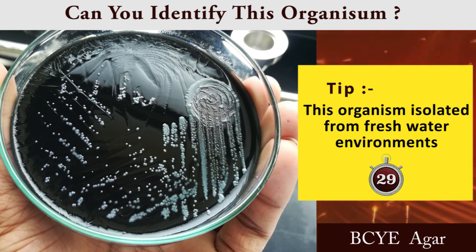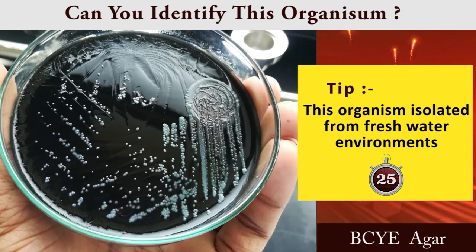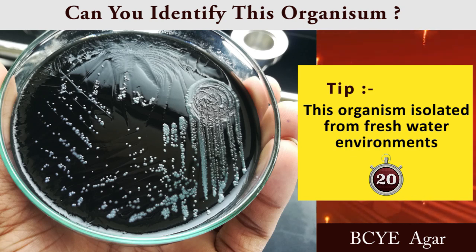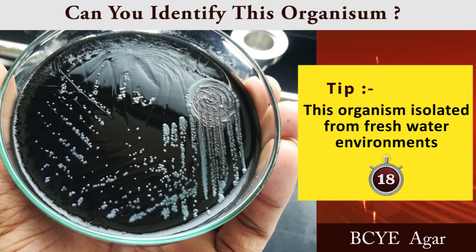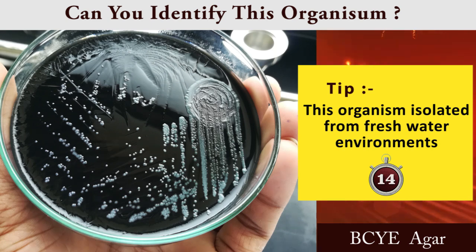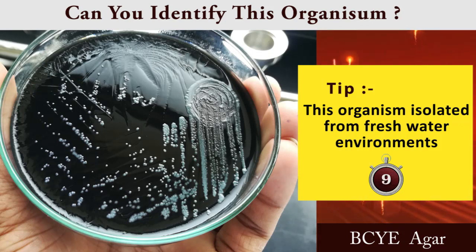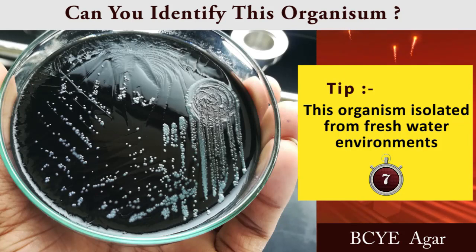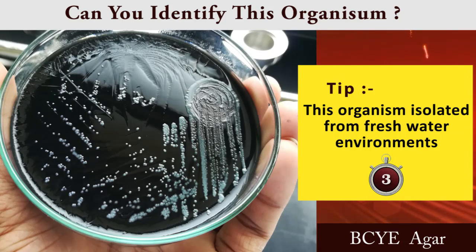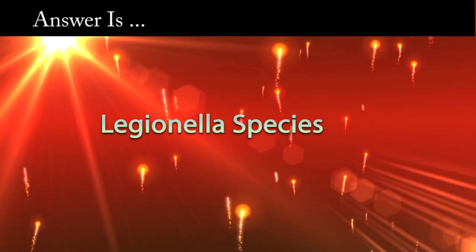Okay, I will give 30 seconds to think of the correct answer. The answer is Legionella species.